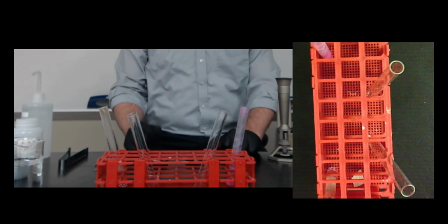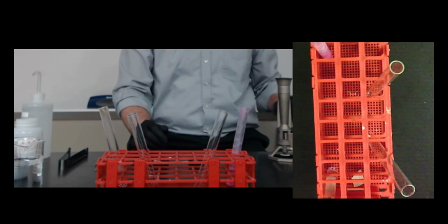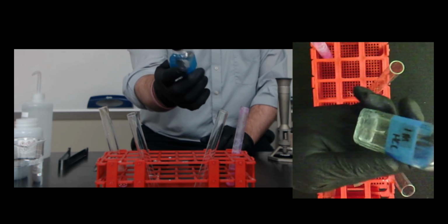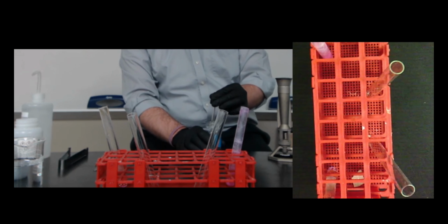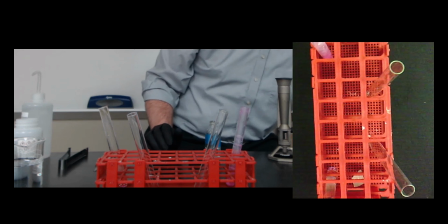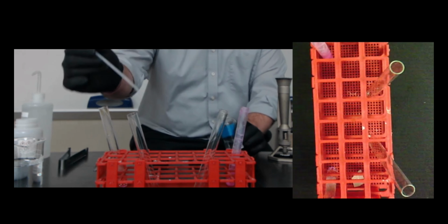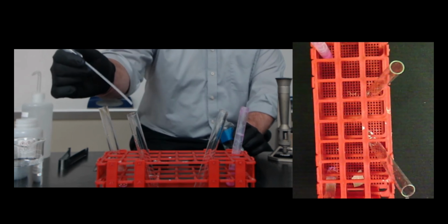All right, now as far as our reaction with acid, we're going to take the same metals and, instead of putting them in water, we're going to put them into a solution of 1 molar hydrochloric acid. This is the same acid that's in your stomach. So this would show us what would happen if we ate these. What would happen in your stomach? Now you shouldn't do that. Do not eat calcium. Do not eat magnesium, at least not in their elemental form. And this will show us why we shouldn't do those things.